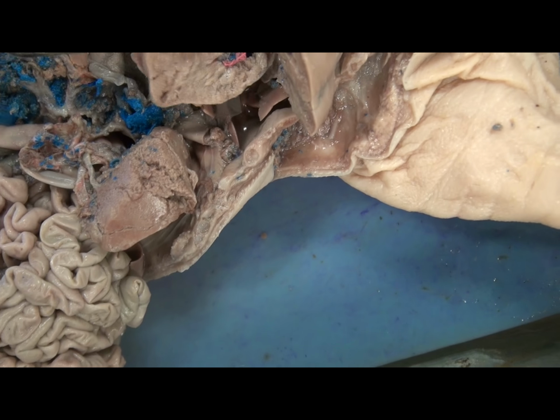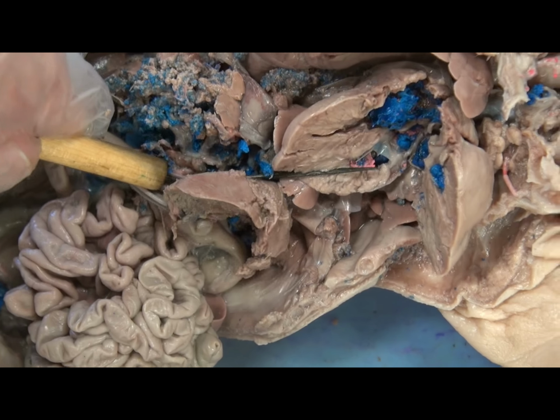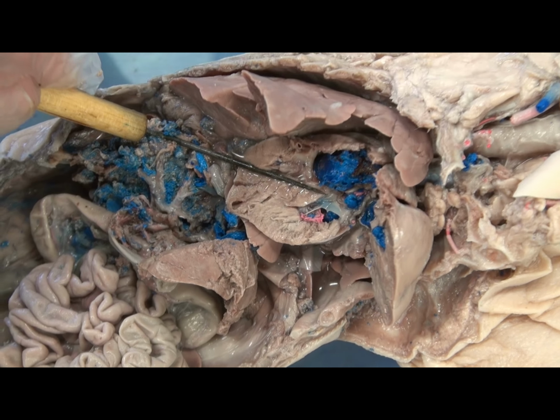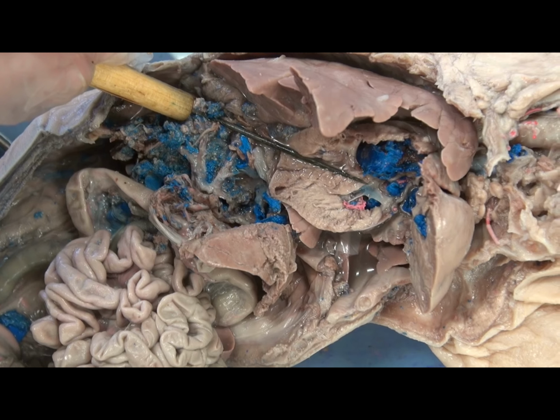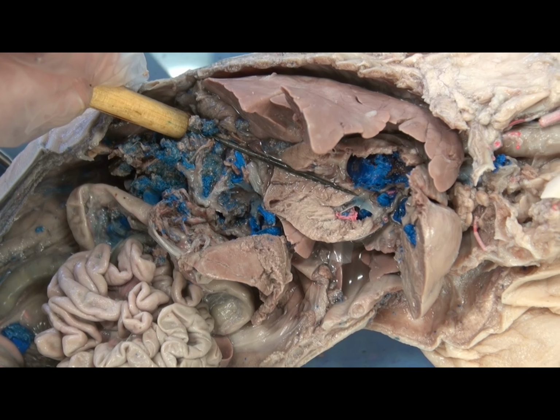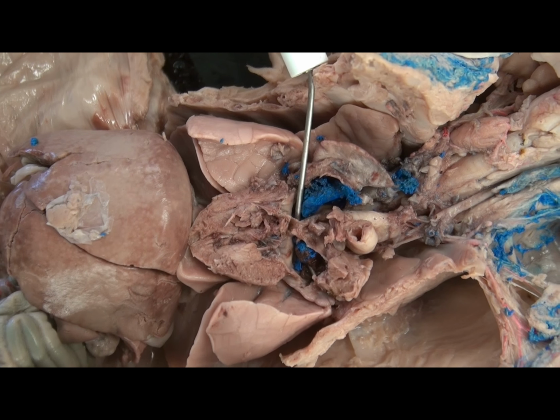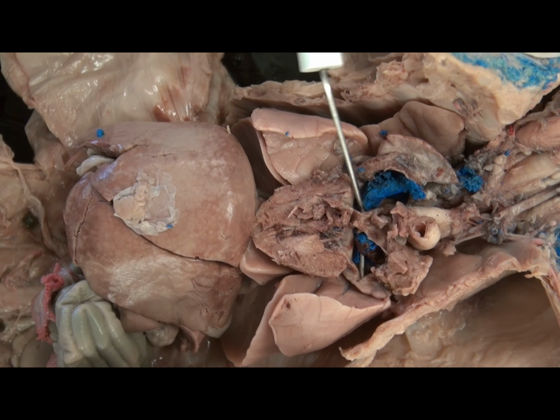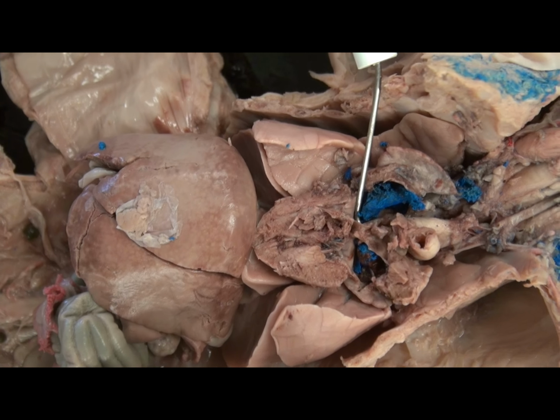Now, the right atrium has a space. So if one were to notice, this is the right atrium and right ventricle. Here's the left atrium, left ventricle, and blood can pass right here through the foramen ovale, the oval hole, and be shunted away from the lungs, which are filled with amniotic fluid, be shunted from the right atrium to the left atrium. So here you can see that there is a space which does not exist in the adult heart. In the adult heart, this foramen ovale will close and form simply a depression, the fossa ovalis.